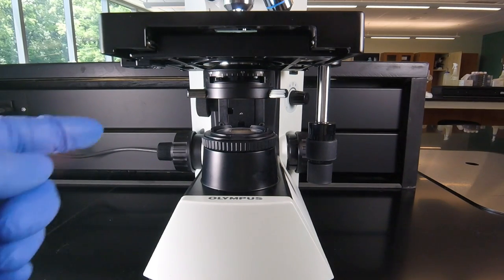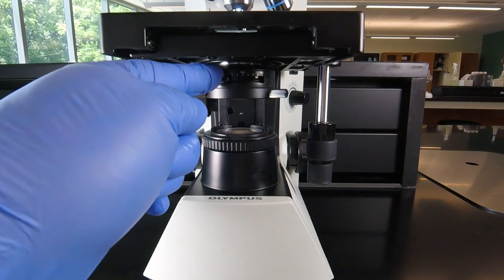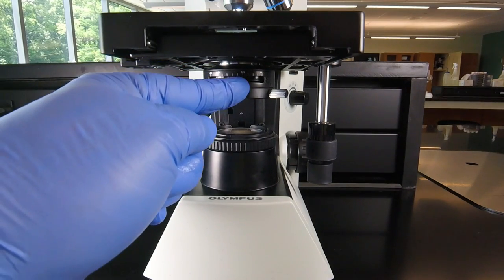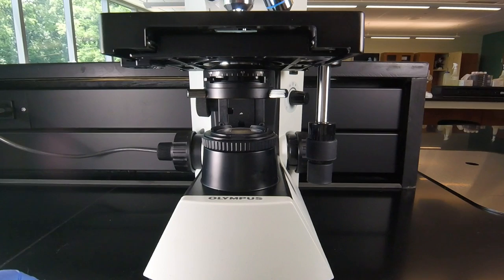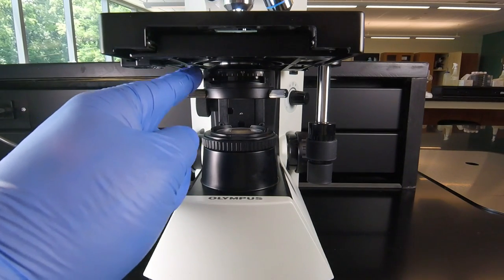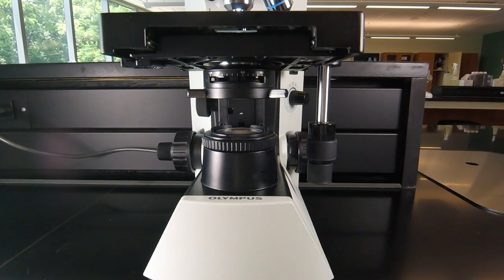So that's the main control we use to adjust the amount of light. If we have too much light coming through the lens, we can reduce the light on the iris diaphragm lever. If we need a little bit more, we can turn it to the left and increase the amount of light. But 0.9 is a good starting point. So now we have enough light where we should be able to see the specimen clearly.